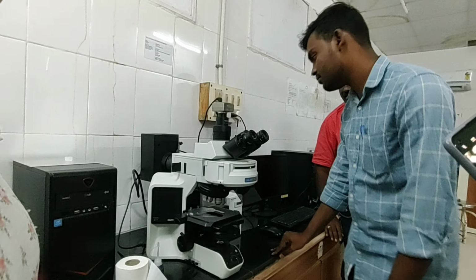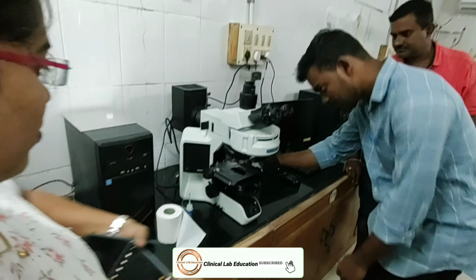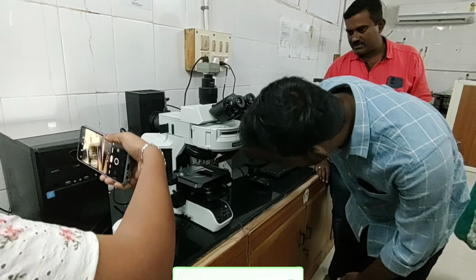Okay, you can start. You can open that. You can slide this.